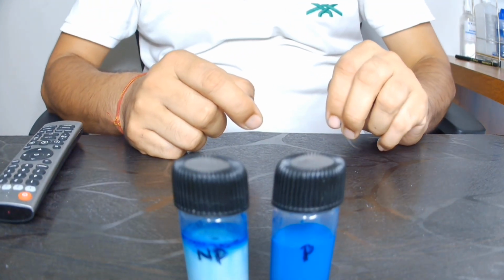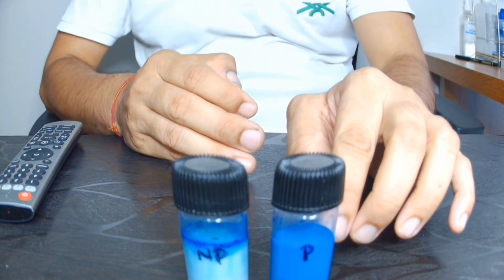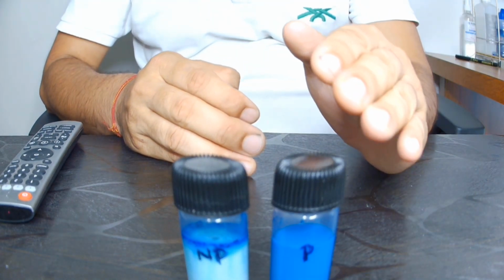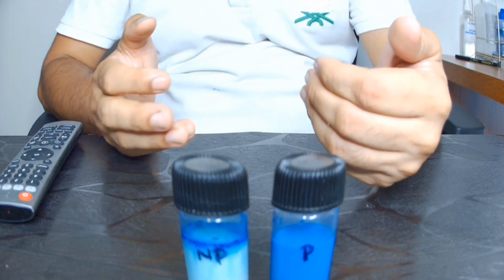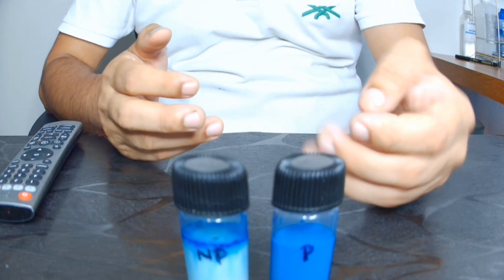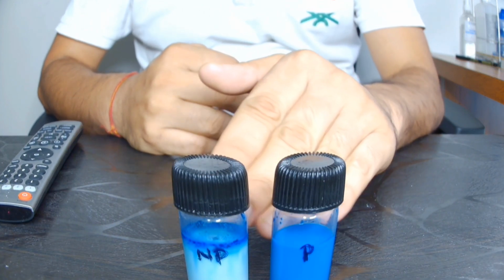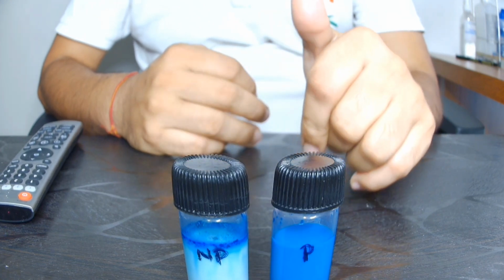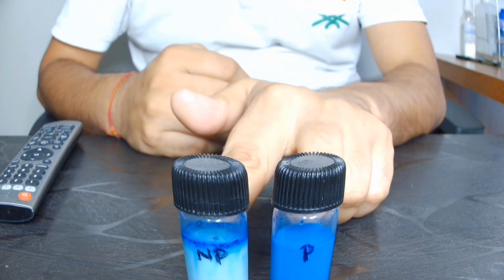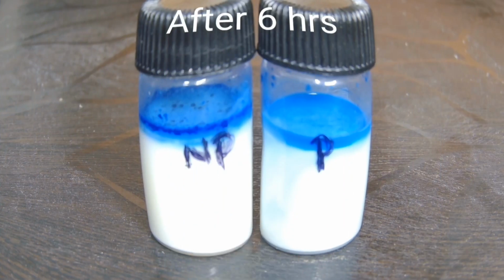Further, there is a chart I can show you. If it is reduced within 15 to 30 minutes, it is of poor quality. If it is taking more than 3 hours, it is of good quality milk. Since both of them took more than 3 hours to decolorize, we can say both were good quality milk. But when we talk about the microbial load, the load was more in the non-pasteurized one, whereas in this one the microbial load was less.